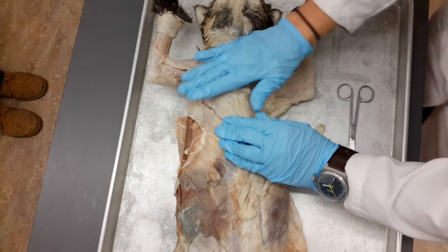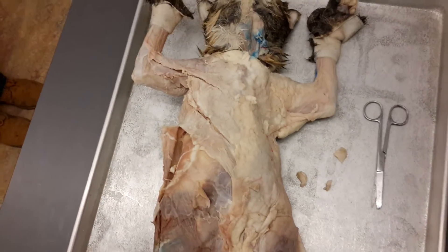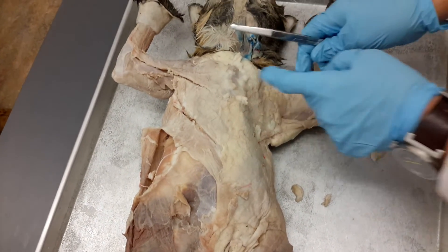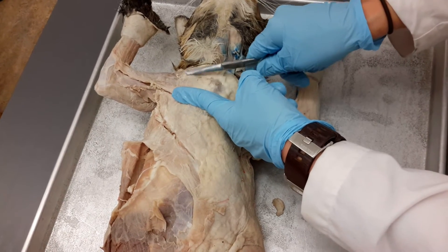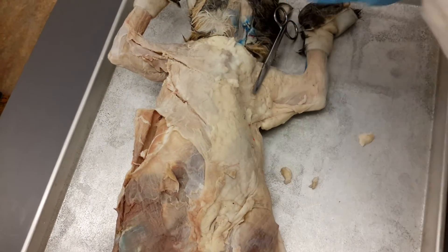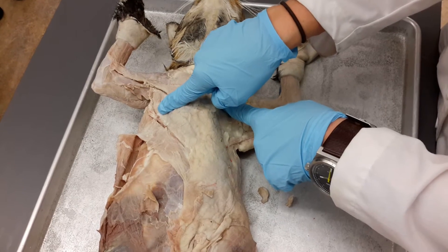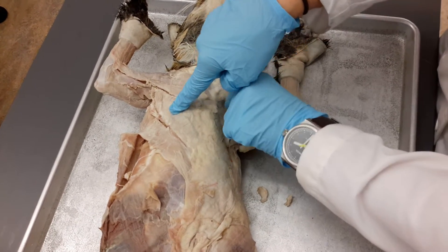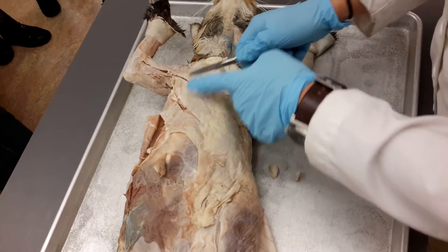So this is how it breaks down on the cat. The chest is a little bit different in the human and the cat. In the human, the outermost one is the pectoralis major, and then underneath it, pec minor. On the cat, the more superior muscle is the pectoralis major — so between my fingers here, pectoralis major — and then below it is the pec minor. So instead of it being on top like the human, one's more towards the head: pectoralis major; one's a little further down: pectoralis minor. If you see a pin here next week, pectoralis major. If you see a pin here next week, pectoralis minor. They have another muscle down here called the xiphihumeralis, but that's a cat-only muscle.